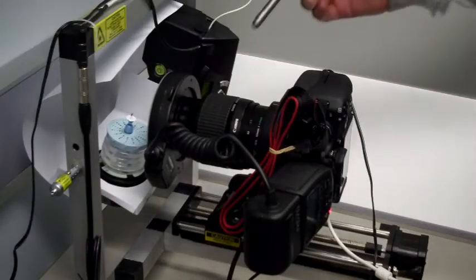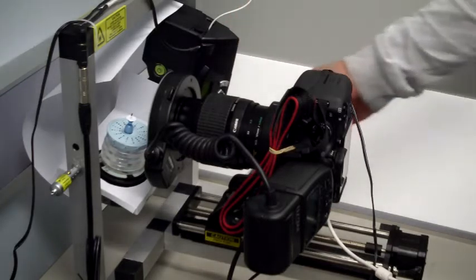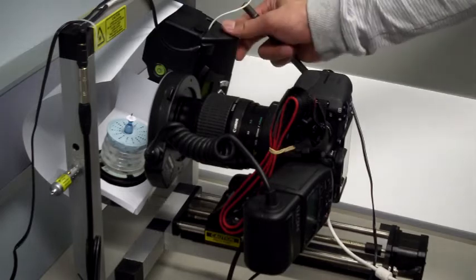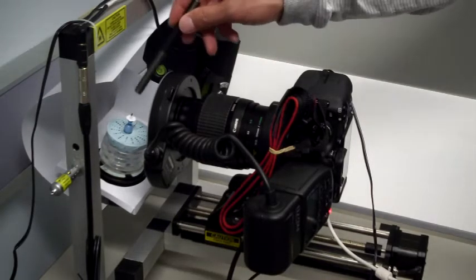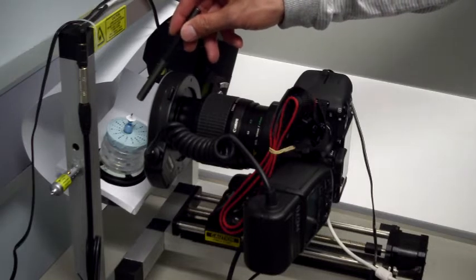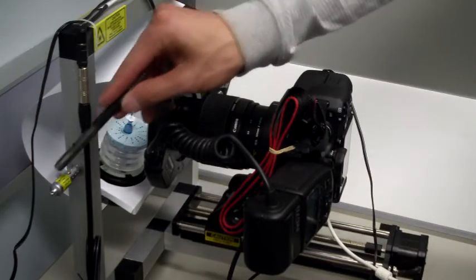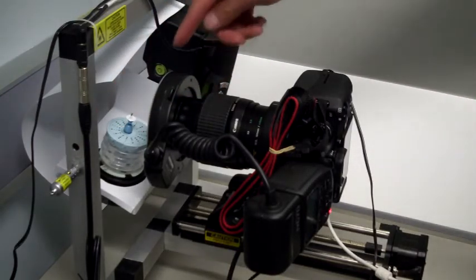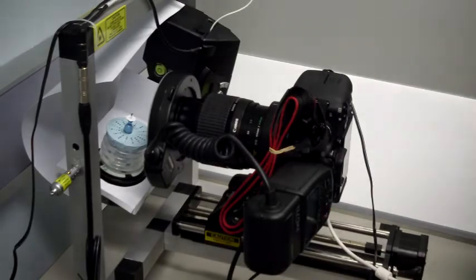Here we have a camera sitting on a macro rail, and we have a turntable which can tilt. We put the specimen in the middle, right at the center of rotation. We have laser alignment here to make sure that the specimen sits at the center of rotation.